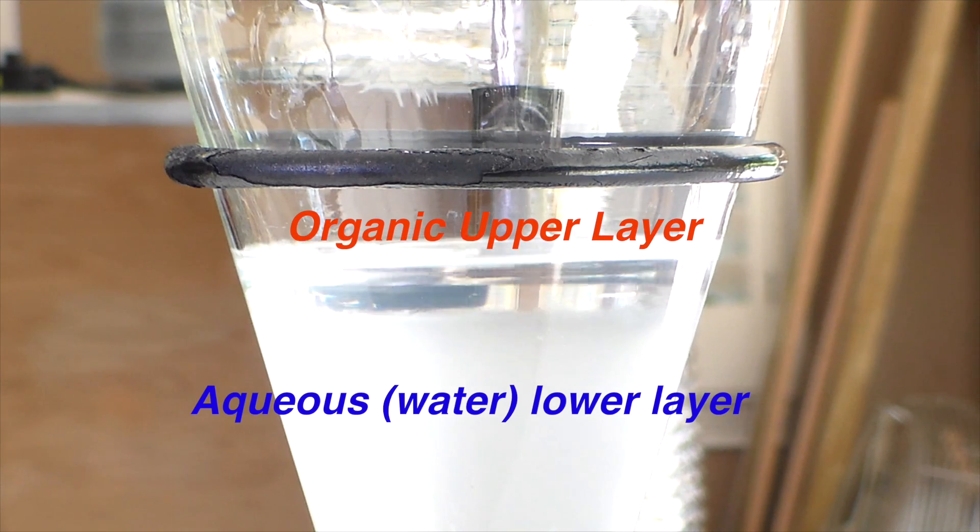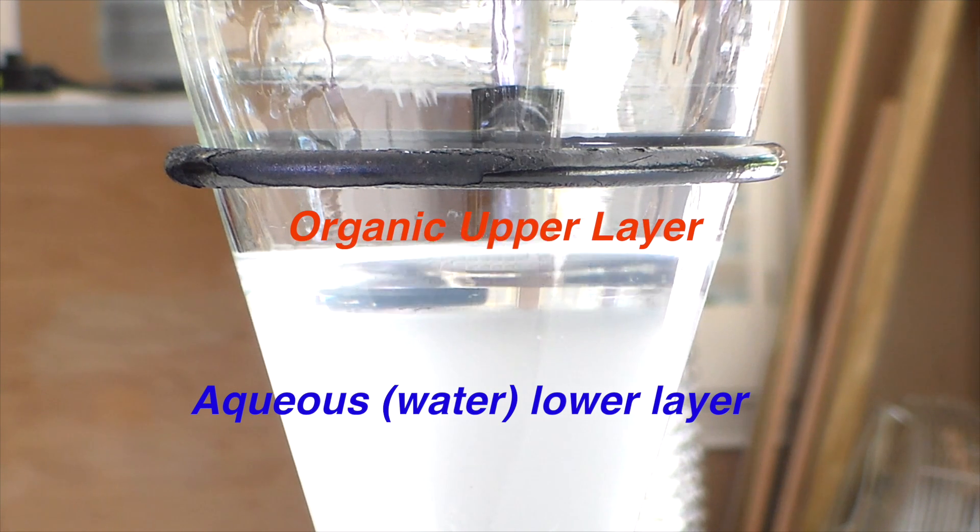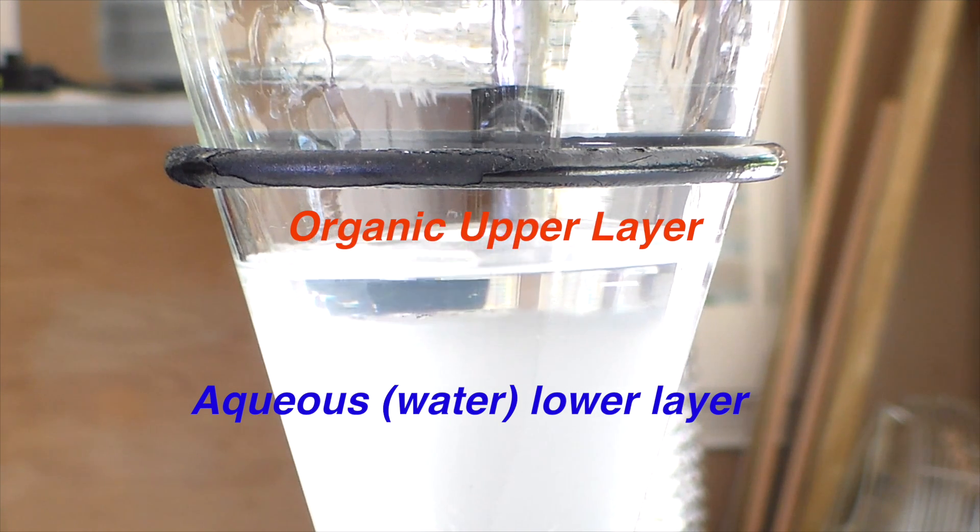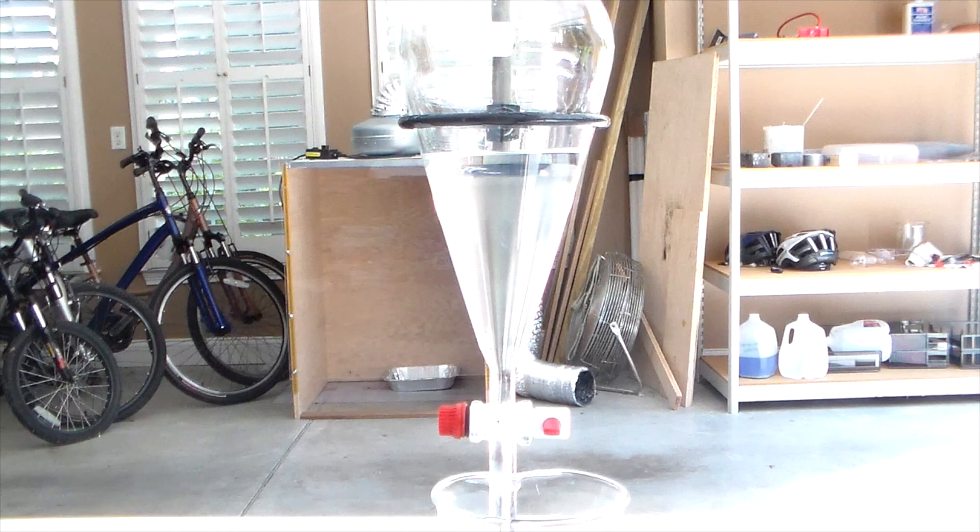After shaking, the mixture separates into an organic upper layer containing our product, and an aqueous lower layer. While those layers finish separating, let's look at how this reaction actually works.